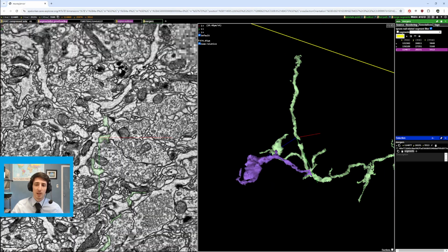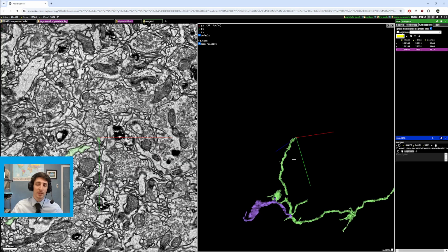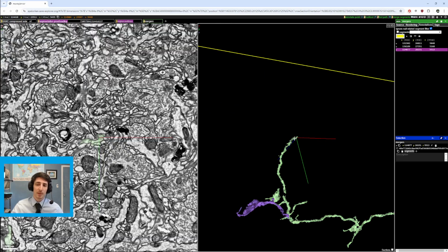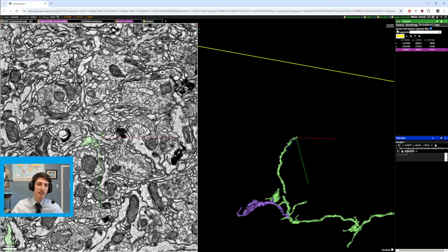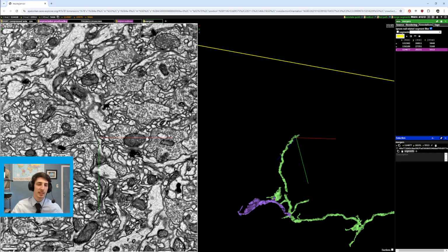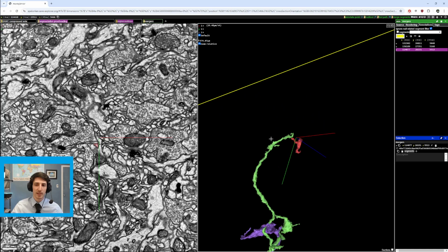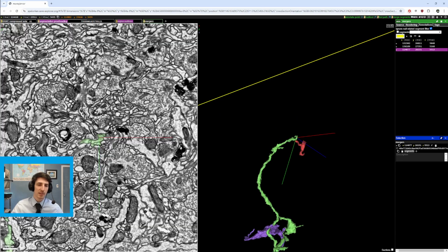so somewhat tactically, I decided, well, this is pretty difficult. Maybe this is a part of the cell, right? You create this idea in your head. If I can get rid of this, then that would be better for this cell. But also, you still want to find out where this path goes. If it's not the current cell you're working on, at least somebody down the line would be able to use that information. So it doesn't look like it goes that far.